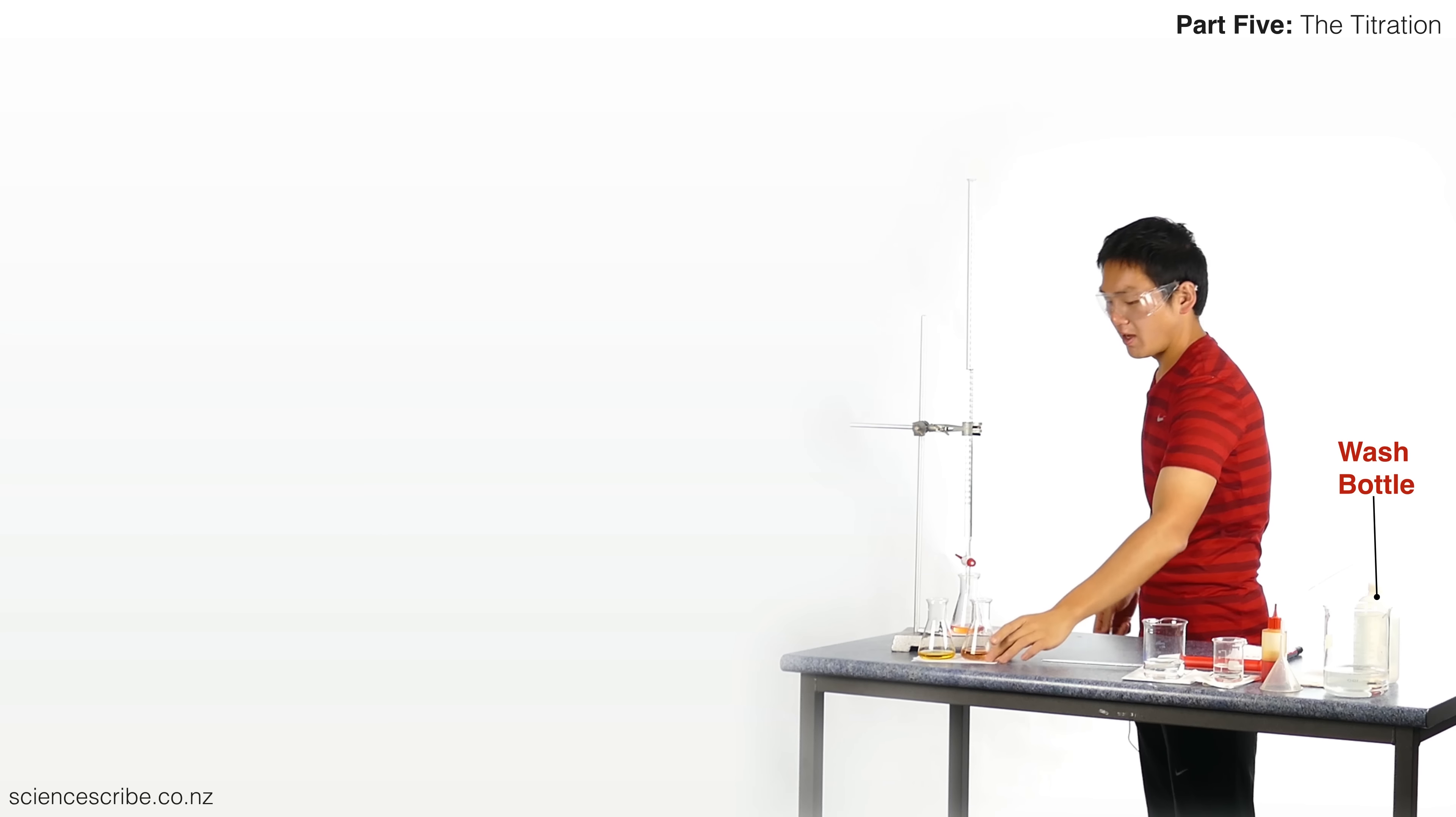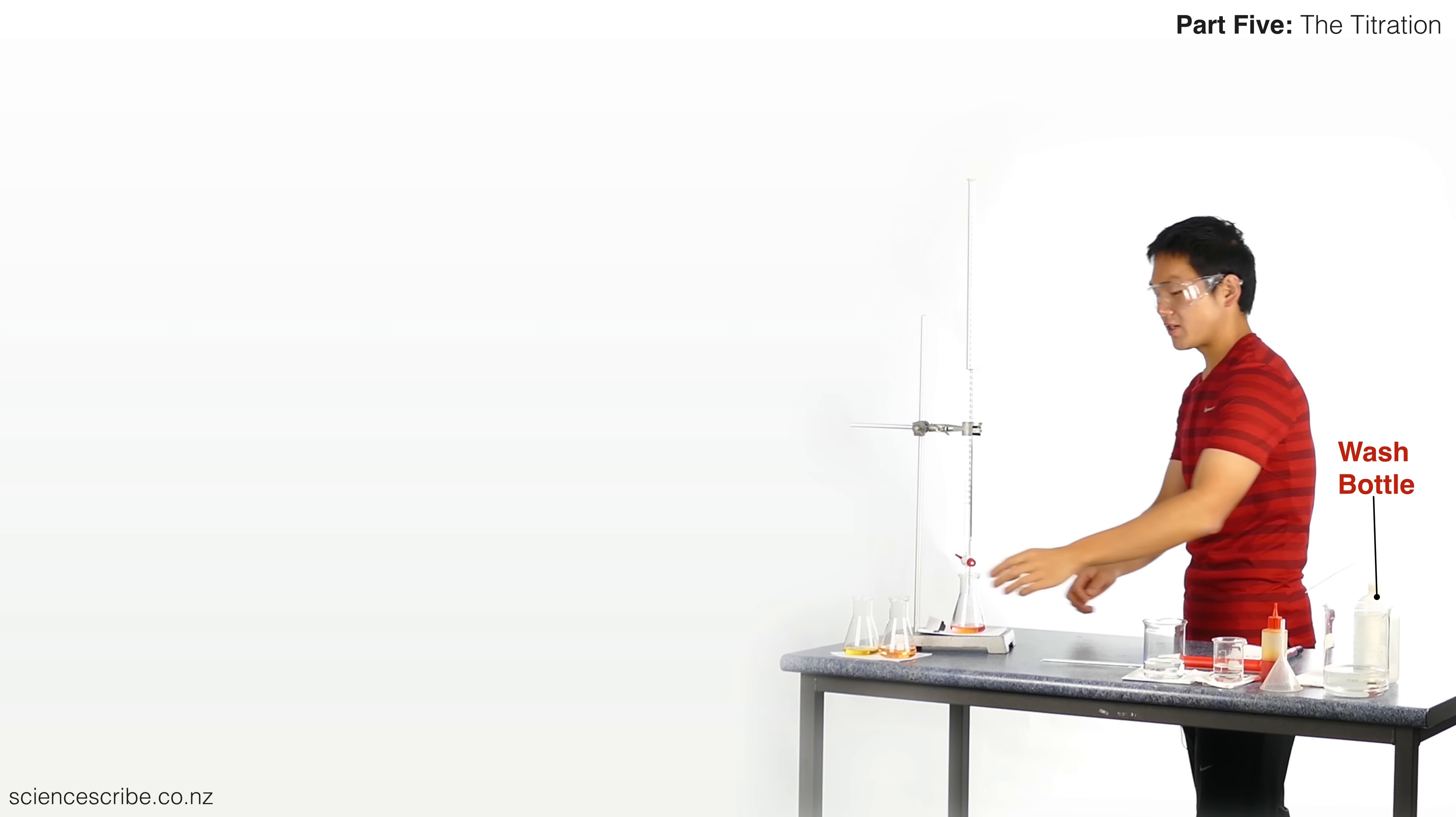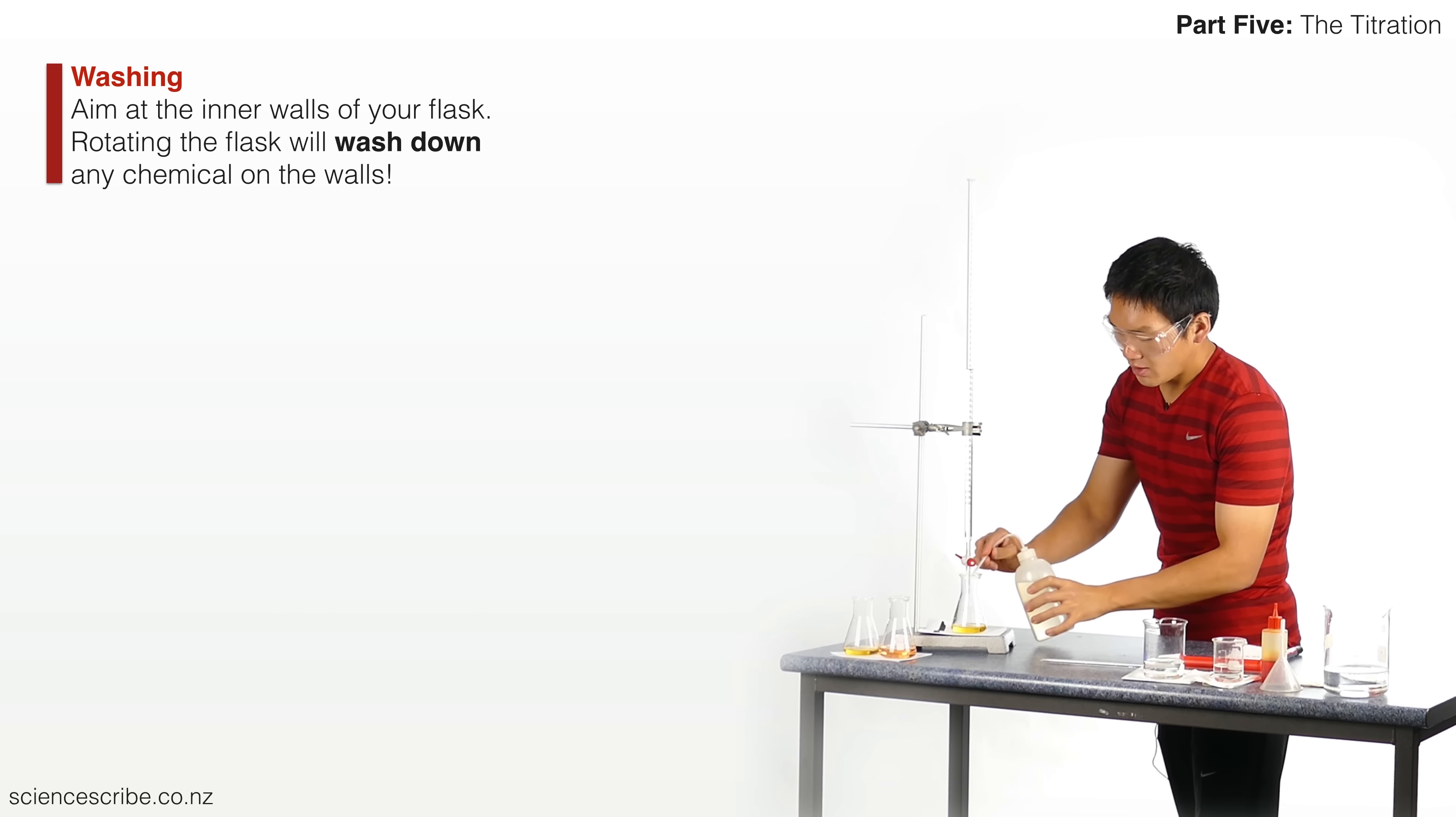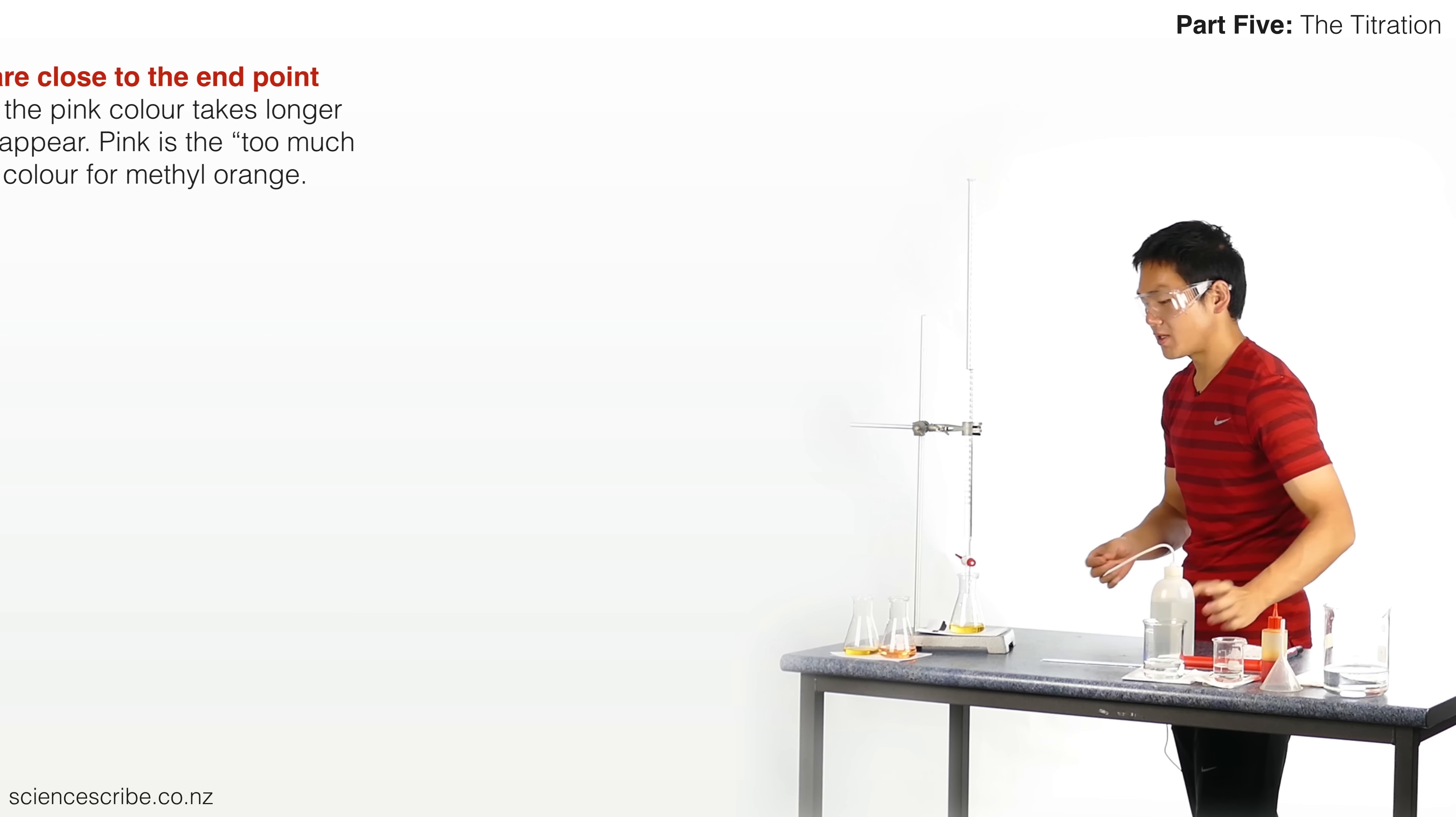Oh wow, look at that! It actually looks pinkish, but if I swirl it you'll find that it goes back to yellow because I'm not actually there yet. Okay, I'm also going to go ahead and just do a little wash down. Now at this point I know that if I go any further I might actually end up being quite close. I'm going to go for just a few drops at a time.